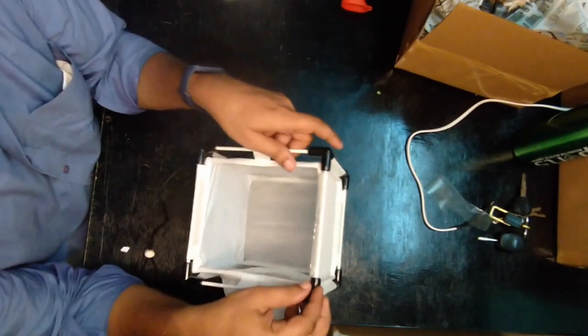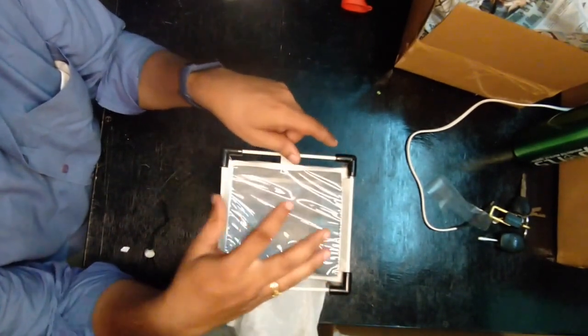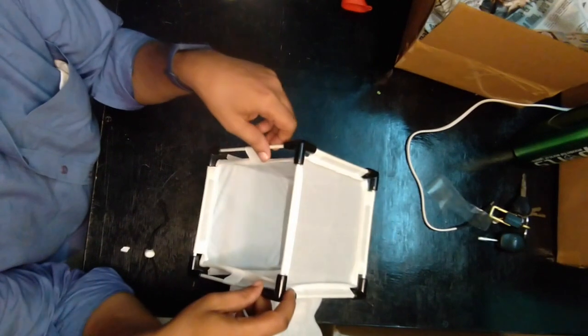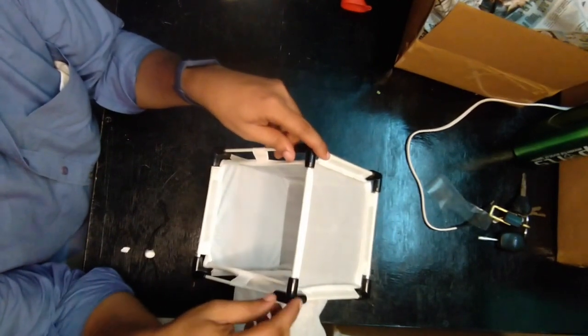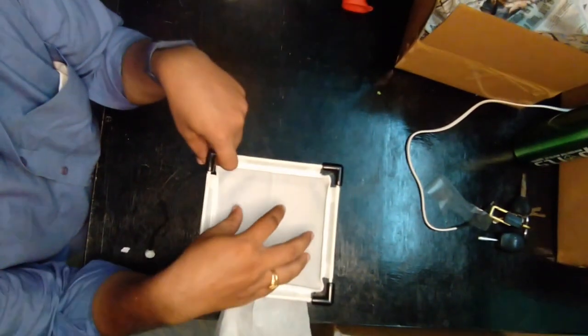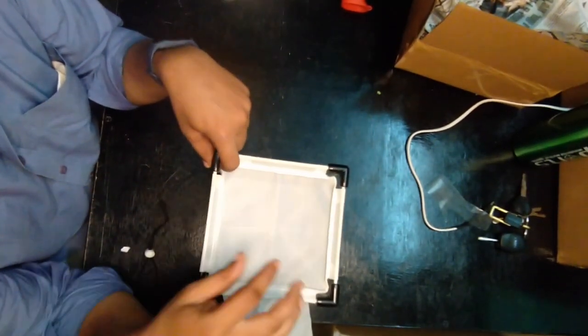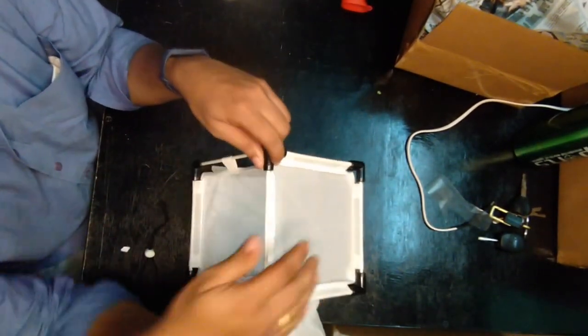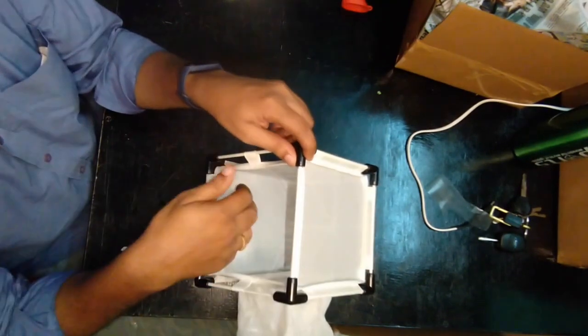When I'm speaking about, say for example, a 15 centimeter cube, what you are getting is a perfect 15 centimeter cube. If the cage is not made as a perfect 15 centimeter cube, what happens with other cages is the sagging of the net from the top and sides.